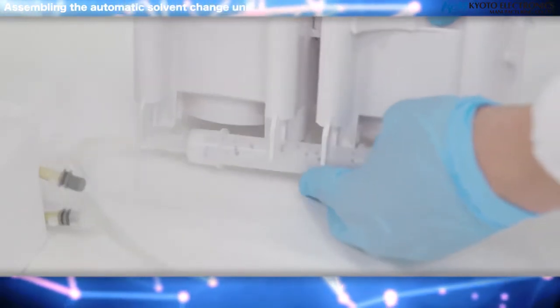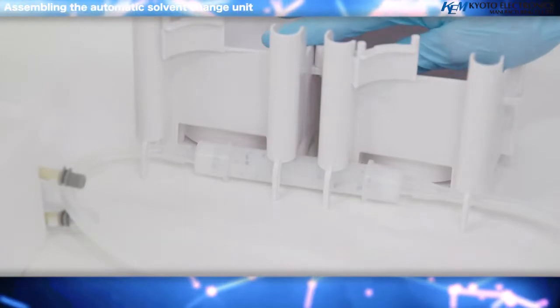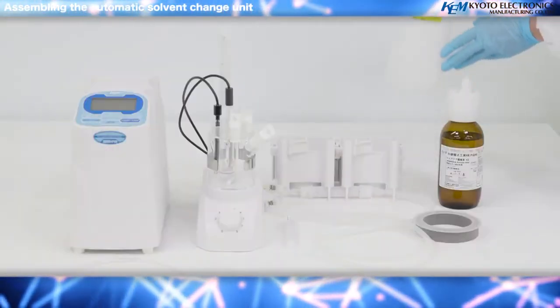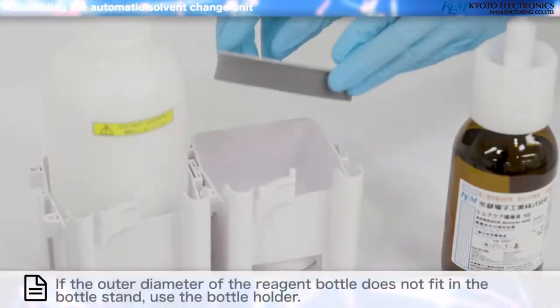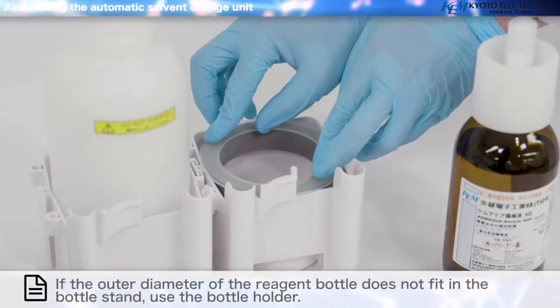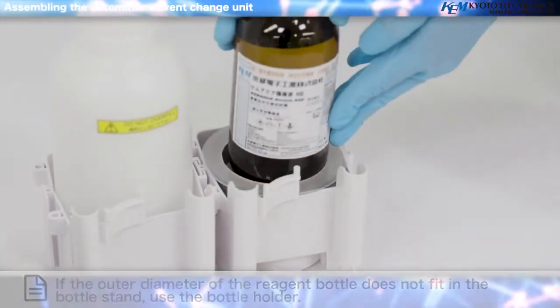Connect the silicone tube to both sides of the desiccant tube. And attach the desiccant tube to the bottle stand. If the outer diameter of the reagent bottle does not fit in the bottle stand, use the bottle holder.